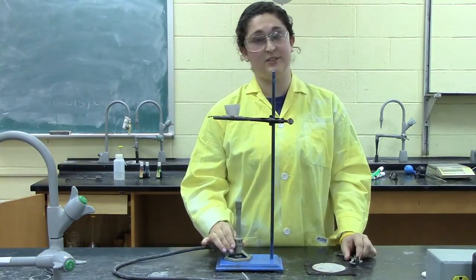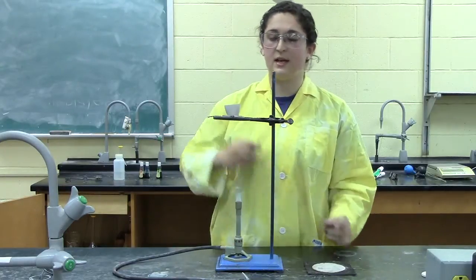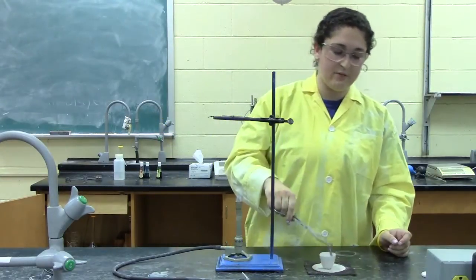Now you're gently heating your sample in order to dry it. Once the drying is done, you can remove your sample and place the cover on top.